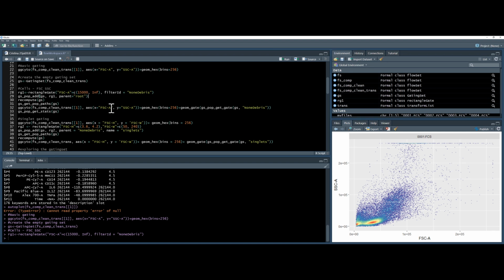I should point out that flowWorkspace in the last few months, and I'm recording this in July 2020, has had a lot of changes recently. And a lot of the commands have changed to make them more understandable. So if you look at some older tutorials, they won't work anymore. So this gs_pop_add, gating set population addition, will add to my gating set, which is gs, which I have over here, rectangle 1, which I've just created, and the parent is root. Root is basically the top level of my data, i.e. all my data.